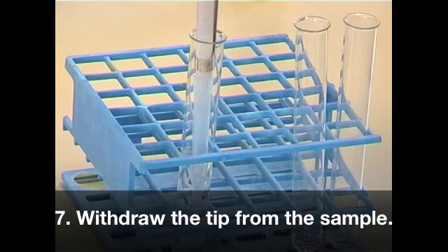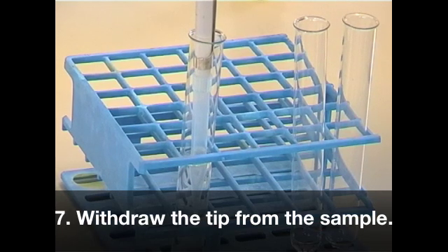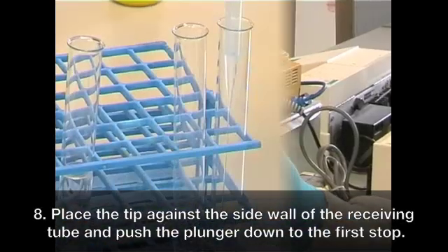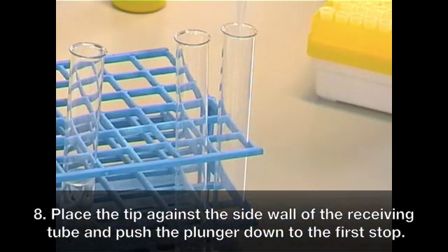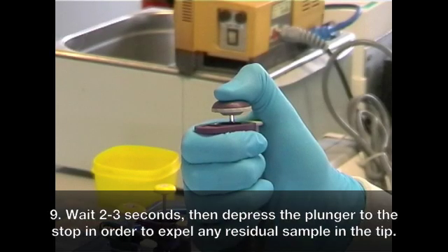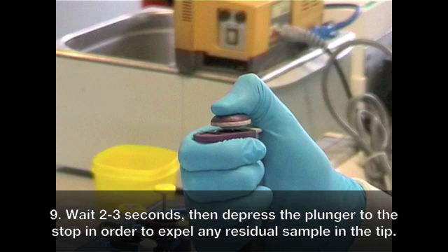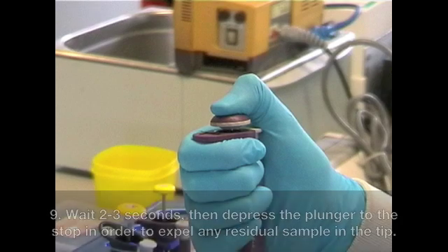Wait a couple of seconds to ensure that the full volume of the sample is drawn into the tip, and then withdraw the tip from the sample. To dispense the sample, place the tip against the side wall of the receiving tube and push the plunger down to the first stop. Then wait 2 to 3 seconds and depress the plunger to the second stop in order to expel any residual sample in the tip.